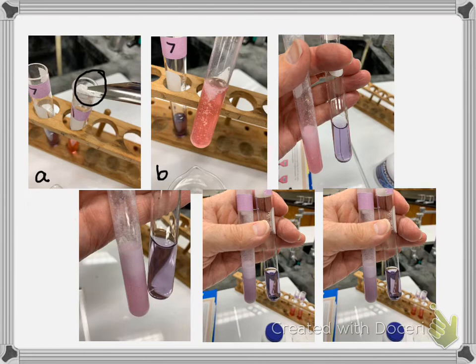And then here I kept adding a little bit more. You can see the colors changing. This is the pH equals to 7. That's what I'm trying to match. Notice that it's not all dissolving in it. There's other things inside the antacid that are chalky. So there it's getting closer, and there it's getting closer. And then finally I thought, okay, this looks close enough to me.